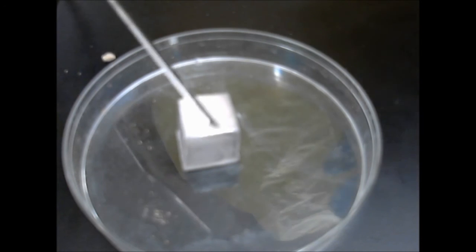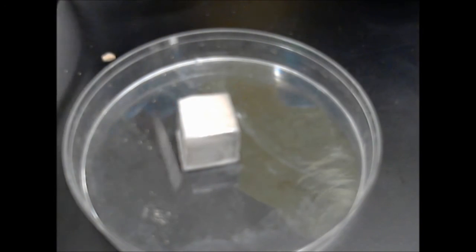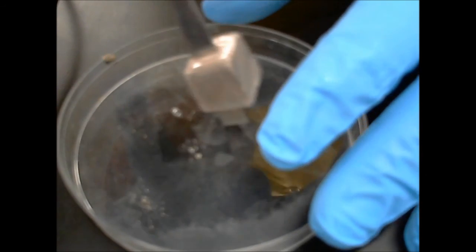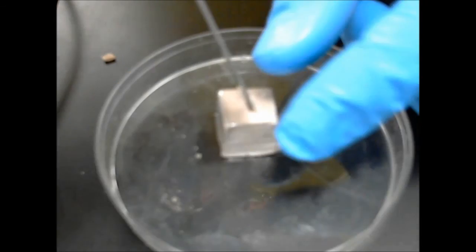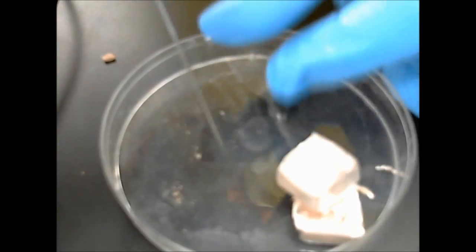Now, one of the things I told you about the alkali metals is that they're extremely soft because of their 1 electron and their extreme malleability. I'm going to demonstrate for you just how soft the alkali metals are. This utensil is about the equivalent of a butter knife. It's not extremely sharp. It's going to be able to cut right through this sodium metal to make a smaller piece. And I'm just going to cut into it with the surface of this knife. And notice that I can stick this utensil right into the sodium metal, and it cuts through it almost like it cuts through really hard butter.